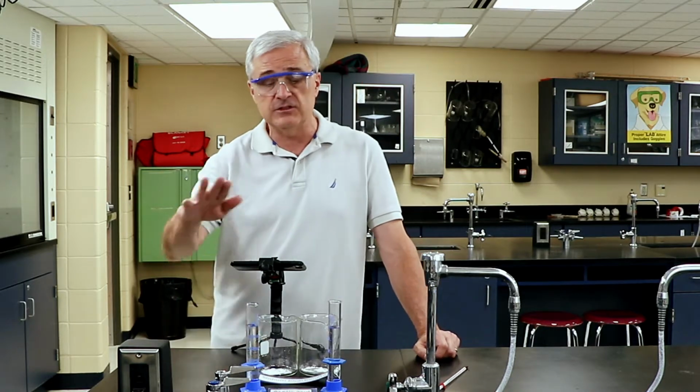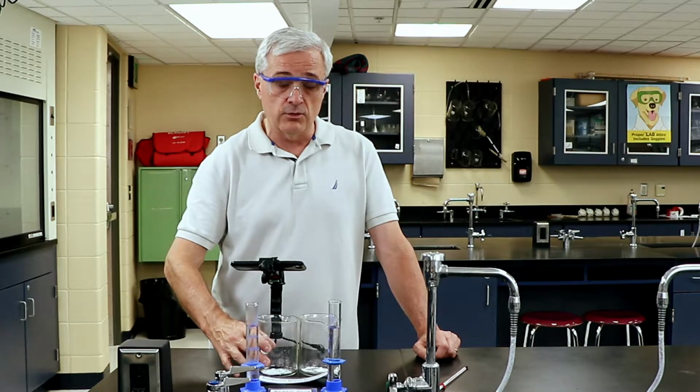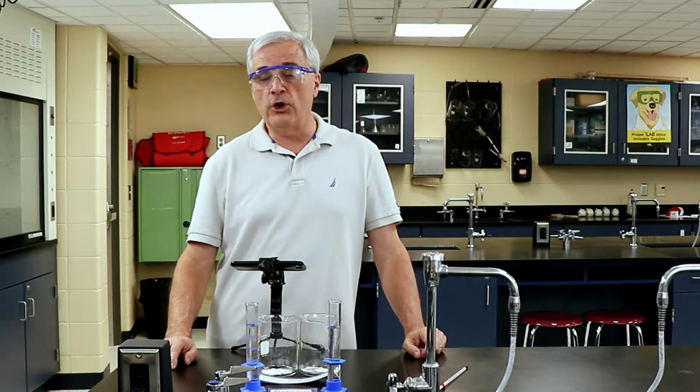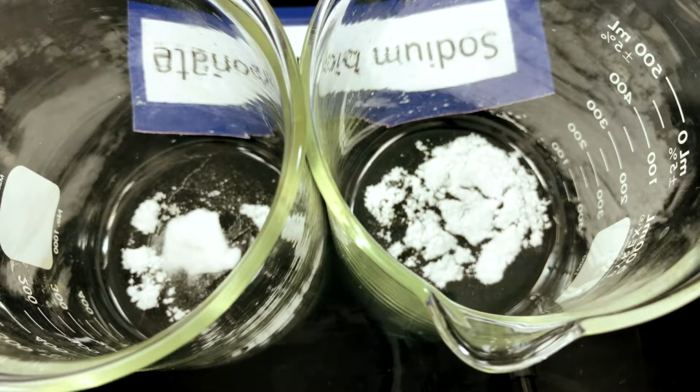Our hypothesis is that lower temperatures result in slower reaction. So we are at 3:30. It is 3:30. Write that down.